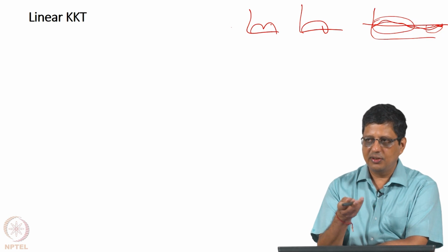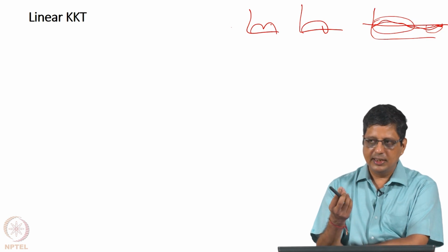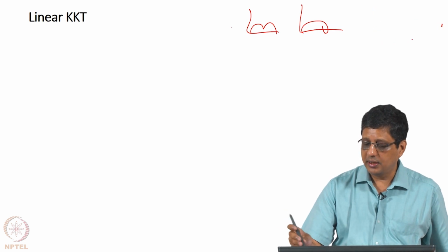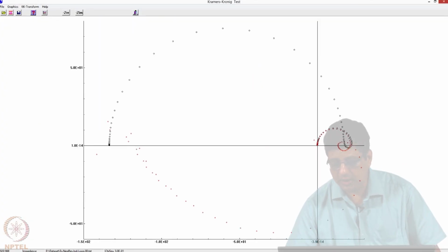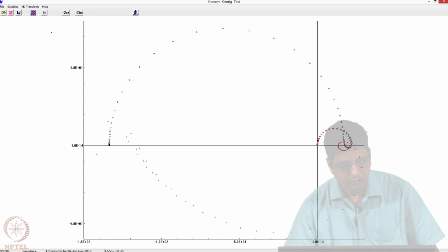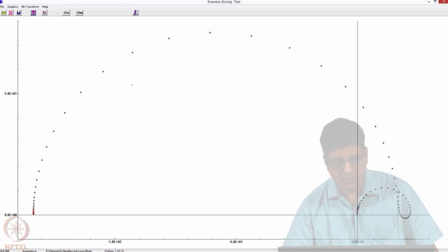But then you have to decide how many experiments you have to repeat. If you have more repeats, your standard deviation will become less as long as the data is repeatable, right. Now let us see if we can clear this. And of course, it tries to model, it is not able to model. The high frequency and up to this level, it is okay. Beyond this, it is not modeling it well. And we expect that if I do this in the admittance mode, it will work correctly. And of course, it goes back to 0 residuals and a very good fit.